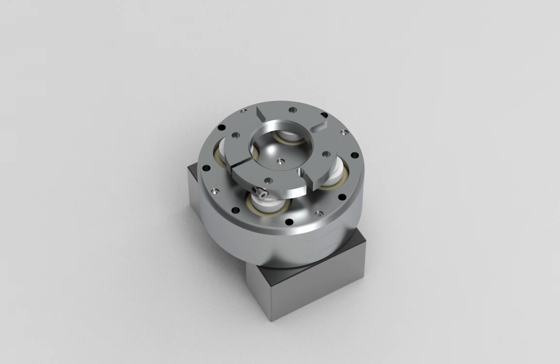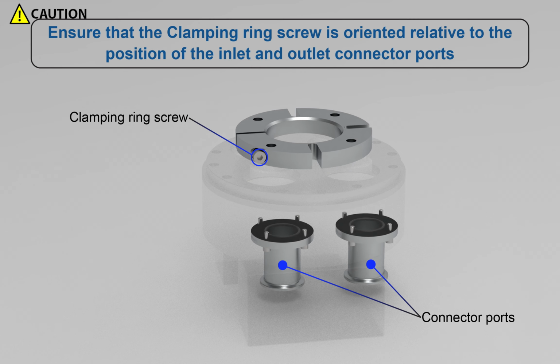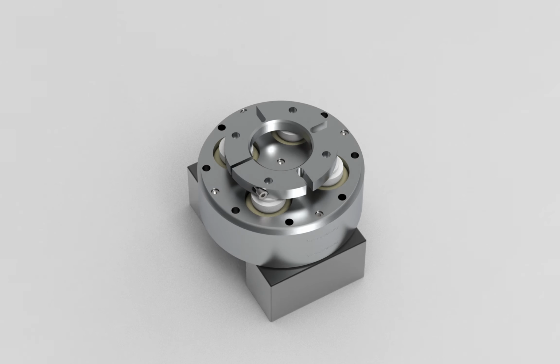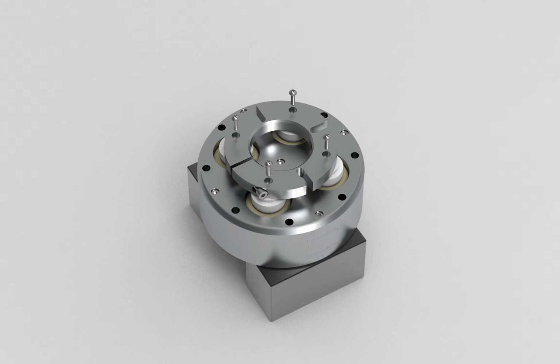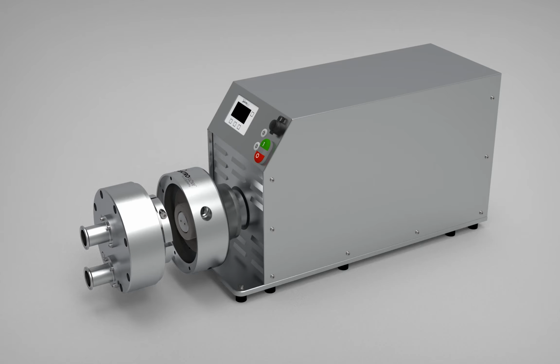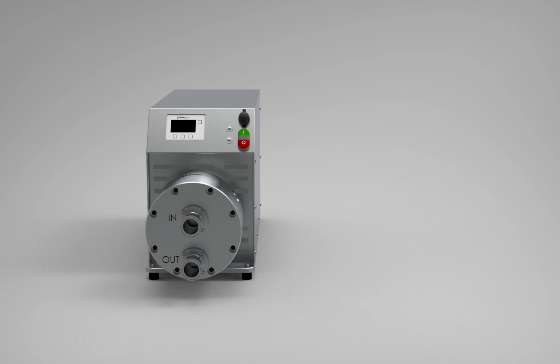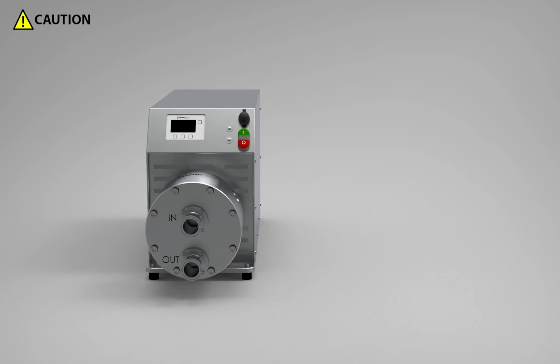Mount the clamping ring. Orientation of the clamping ring screw is important. Fasten the screws in crosswise sequence, with the torque of 6 Nm. Mount the pump chamber. Fasten the screws in crosswise sequence, with the torque of 35 Nm. Hold the pump chamber while fastening the screws for safety precaution.